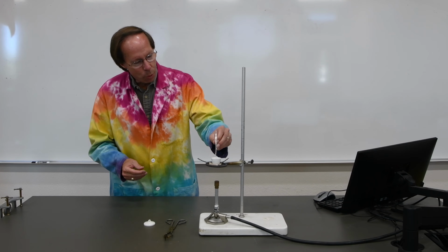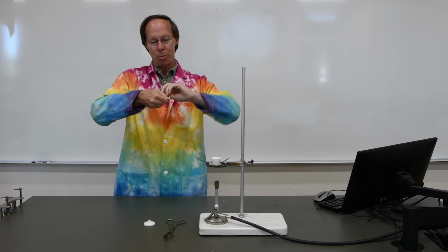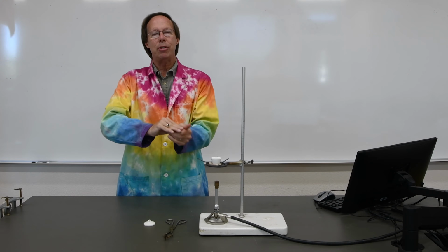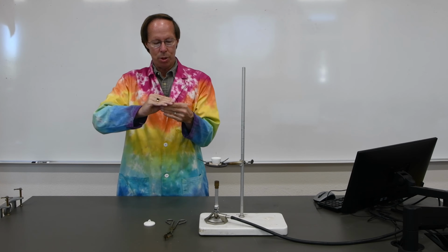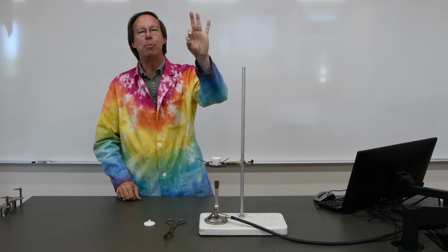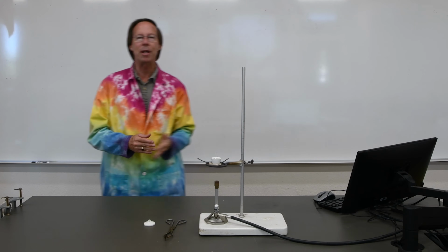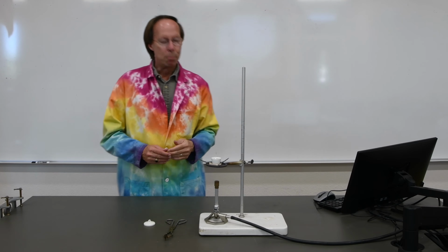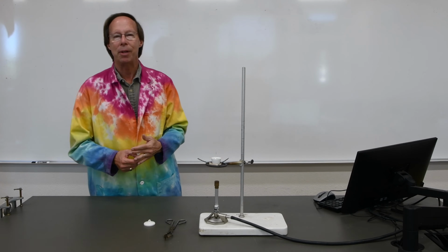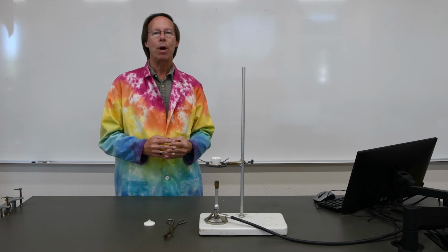The magnesium ribbon, of course, needs to fit in that crucible, so we're going to take our piece of magnesium ribbon and sort of crumple it up into a loose ball. It needs to be small enough to fit into the crucible, but we want to leave room for air to move around in between the pieces so it burns completely. So we can put our magnesium, it fits in there very nicely. We'll go ahead and burn that and then treat the product as it specifies in the lab procedure, and at the end we'll be able to weigh the magnesium oxide product.